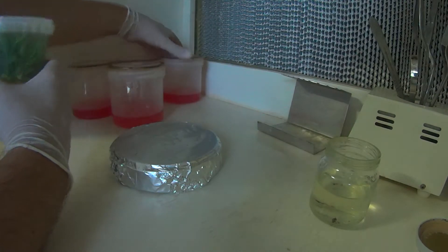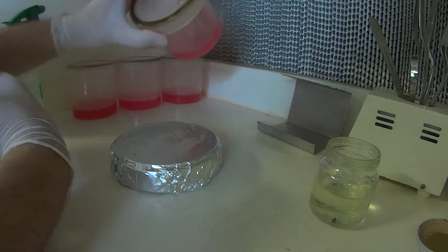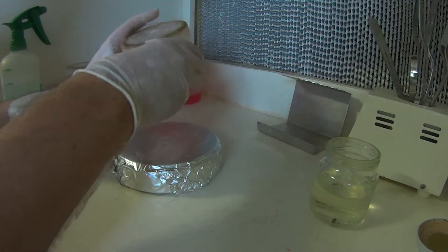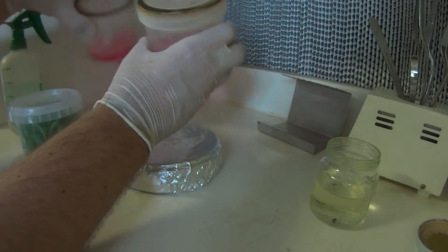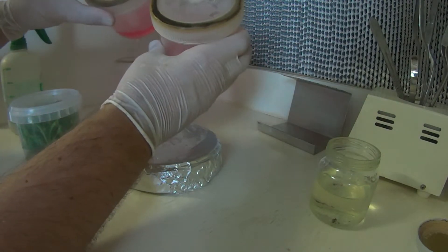Like I mentioned before in the other video, vent spots. All these containers here are vented, a couple of different types of vent spots. These two are fabric type.